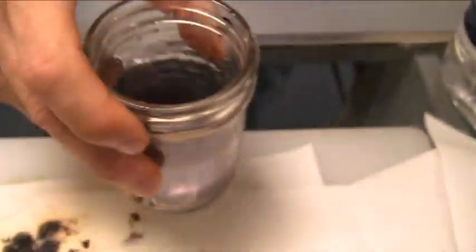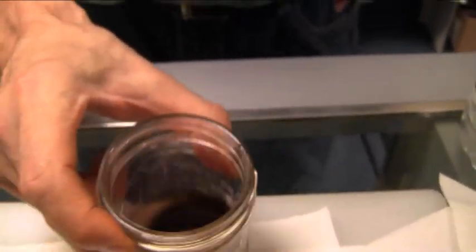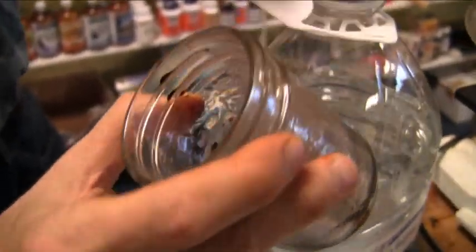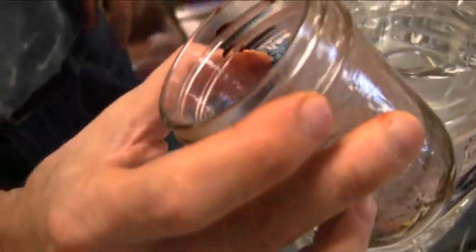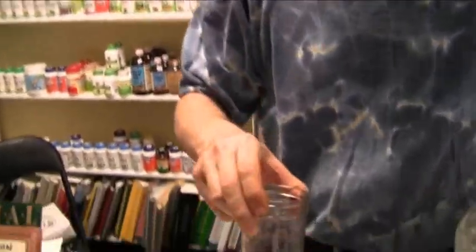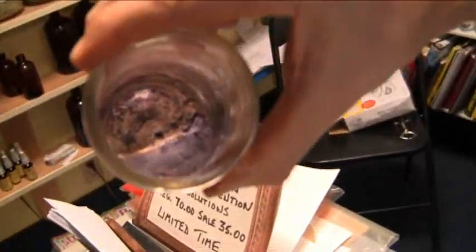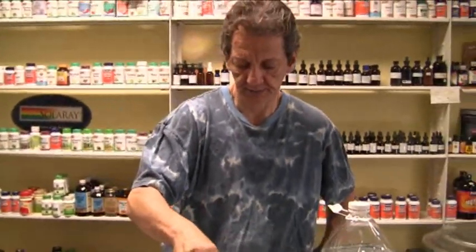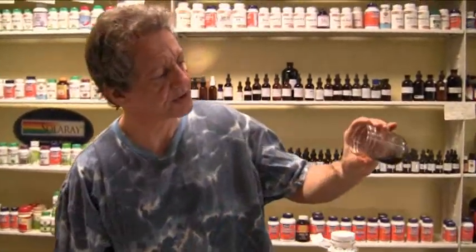Work that kind of thing. There we go — see there? Crystals are starting to form. So now you've learned that if you put too much fluid in there it won't work well — see this one is starting to form. You will start seeing more crystallizing effect. When we did it the first time we put more water than we had iodine. We're getting a lot more now — look at that. Keep swirling it.